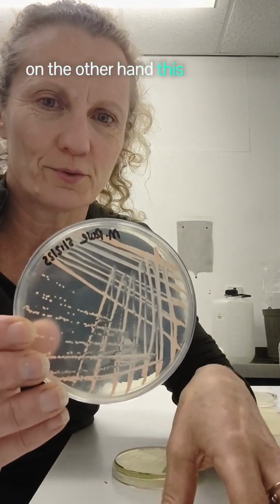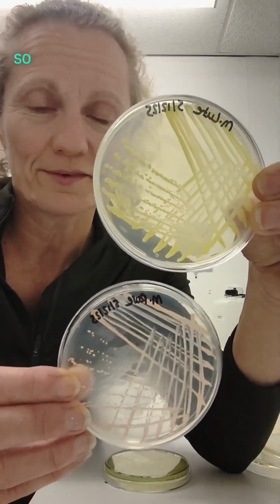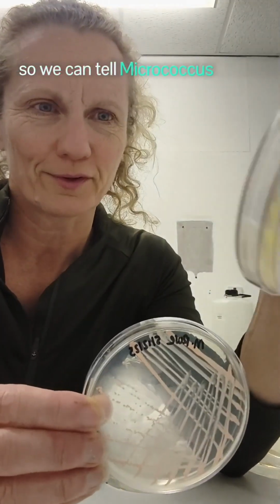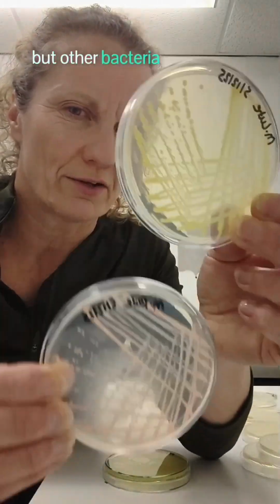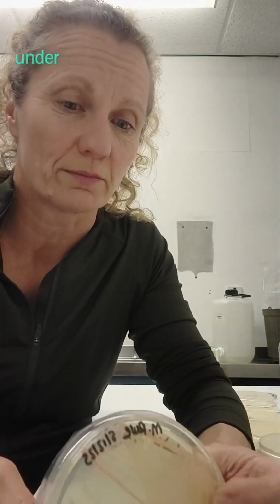On the other hand, this organism, Micrococcus luteus, look, it's grown yellow. So it's still a micrococcus organism, but it's yellow. So we can tell Micrococcus luteus, it's got this very bright yellow colour, and then the roseus as well. We can tell what it is by looking at it on the agar plate. But other bacteria do produce these kind of colony colours, so we can't make an assumption until we've looked at it under the microscope and done some tests.